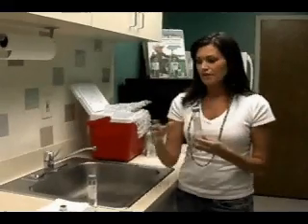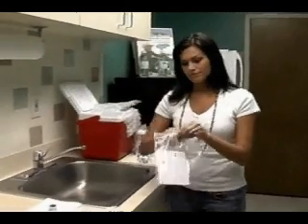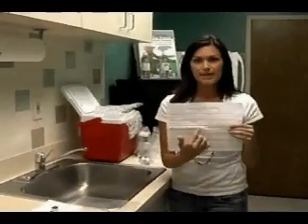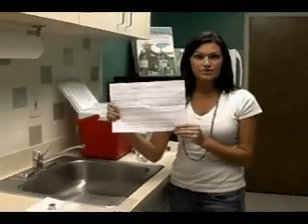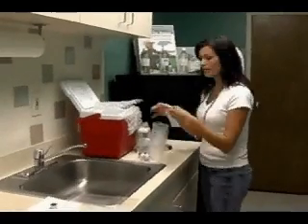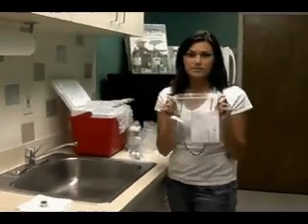After you have done this, you will fill out the label on the bottle completely, on the sample and its duplicate. You will also fill out your chain of custody form completely. On the back of the chain of custody form, you will find directions for sampling and shipping and also important phone numbers in case you ever need to call us with any questions or concerns. This chain of custody should be shipped back to us in the Ziploc bag to ensure that it doesn't get wet and is legible when we receive it.